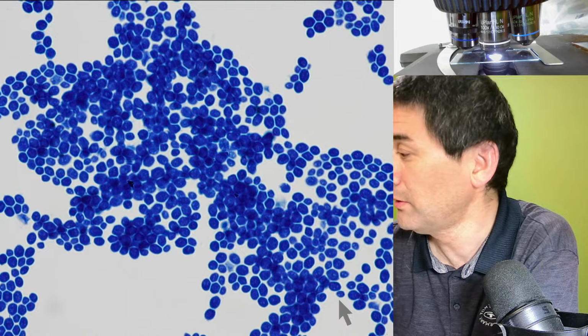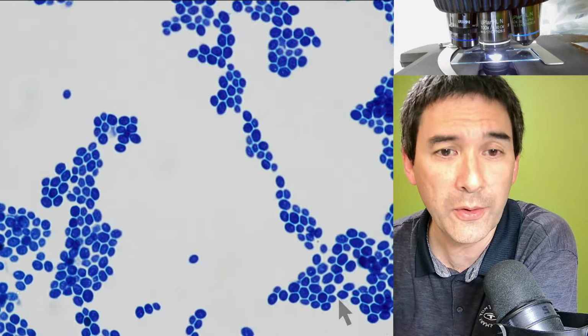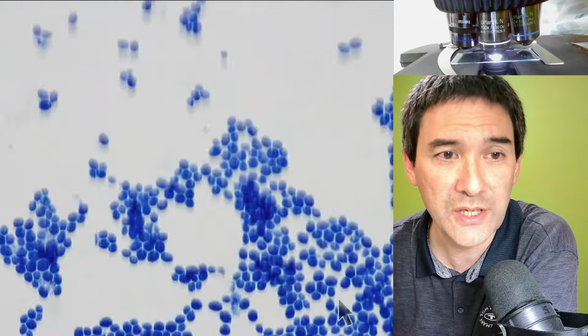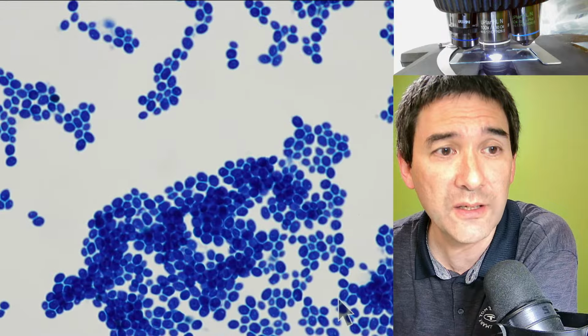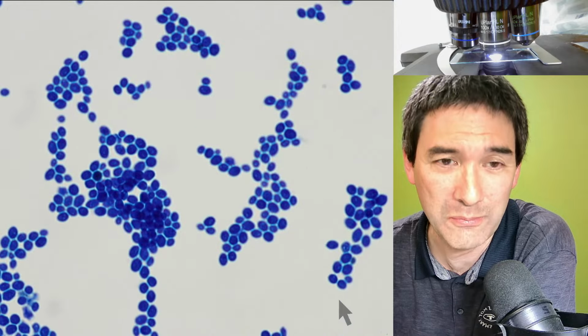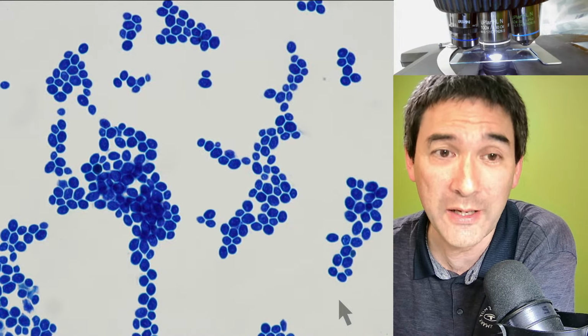And maybe we can actually move around a little bit. Maybe I'm able to find the place where the cells are not stained somewhere. So most of them are actually stained, as you can see. And another thing that you might be noticing, I just want to mention: the cells are now surrounded by oil.